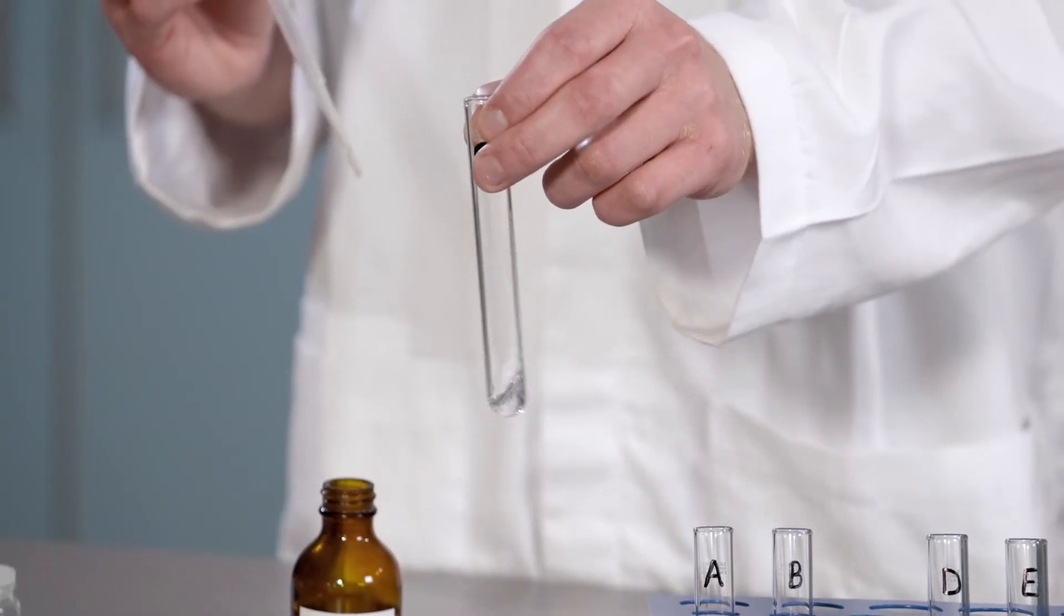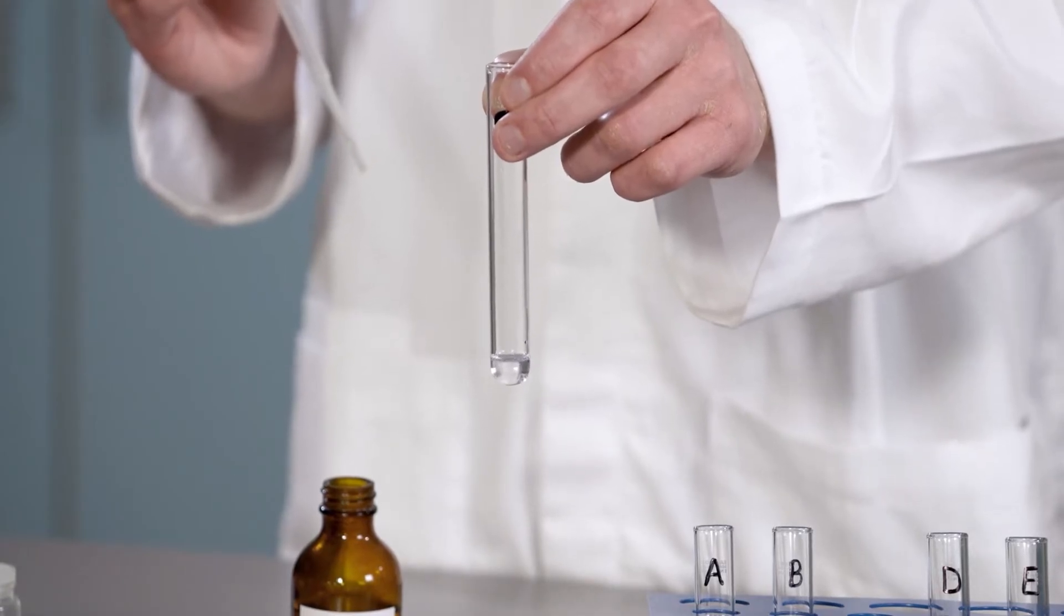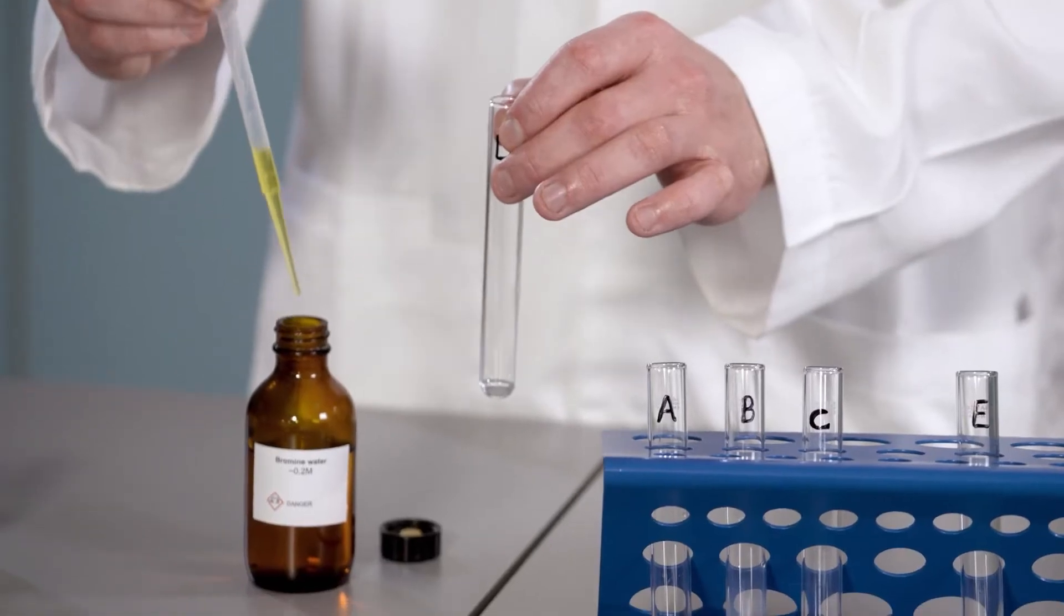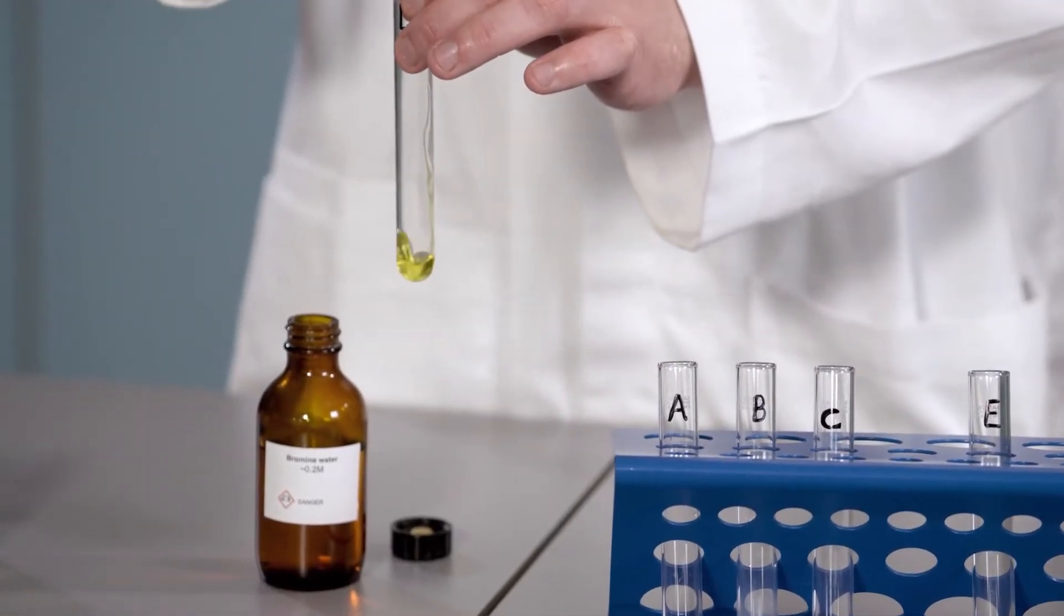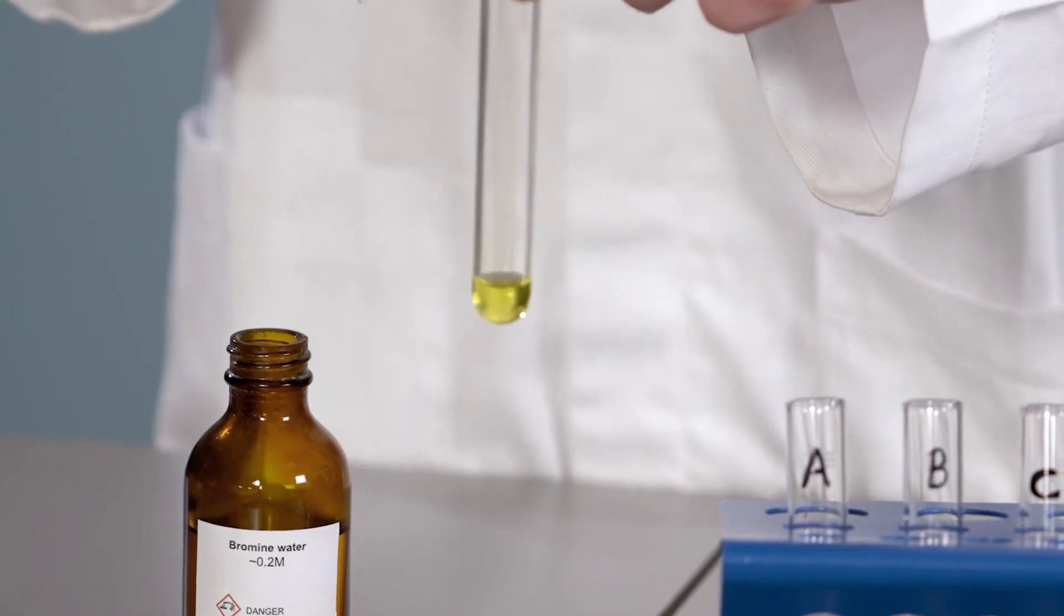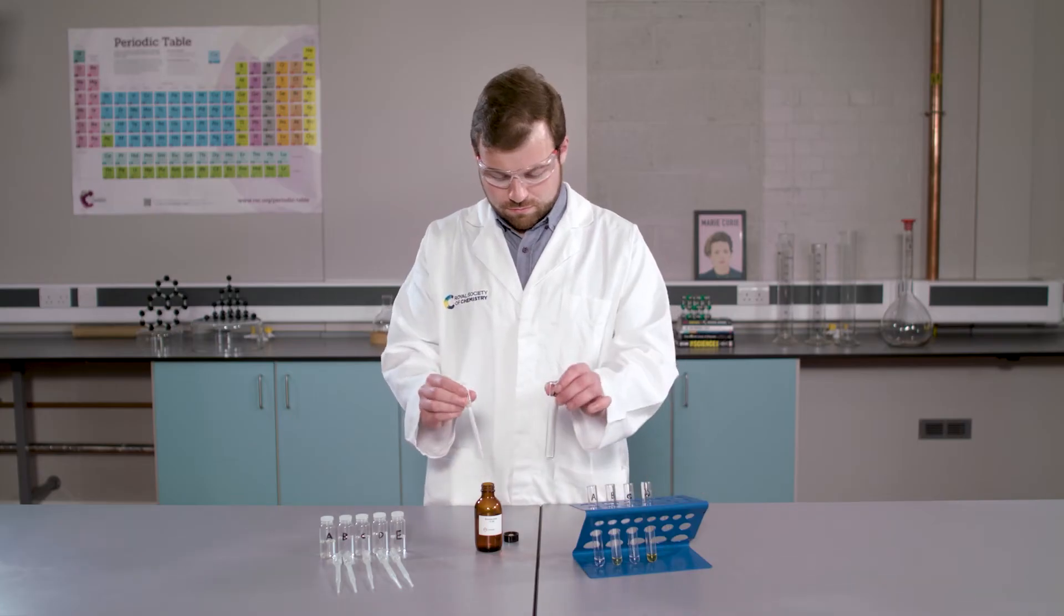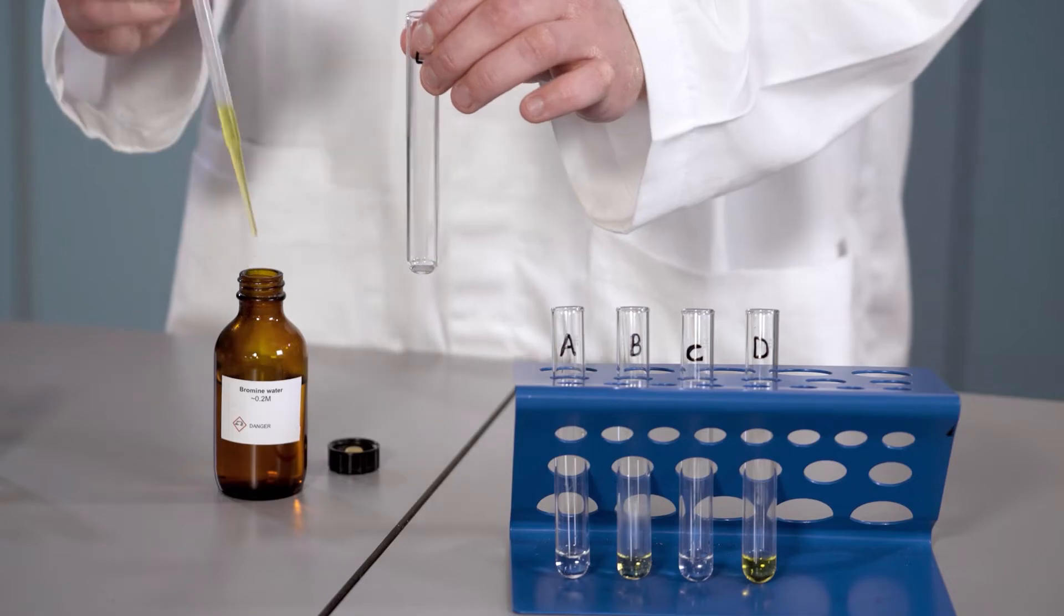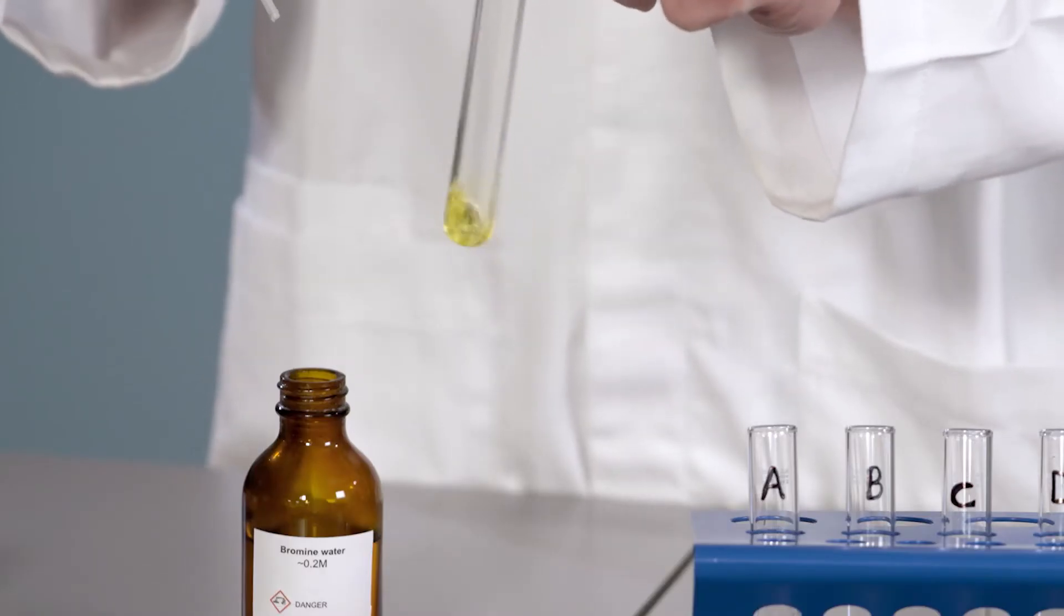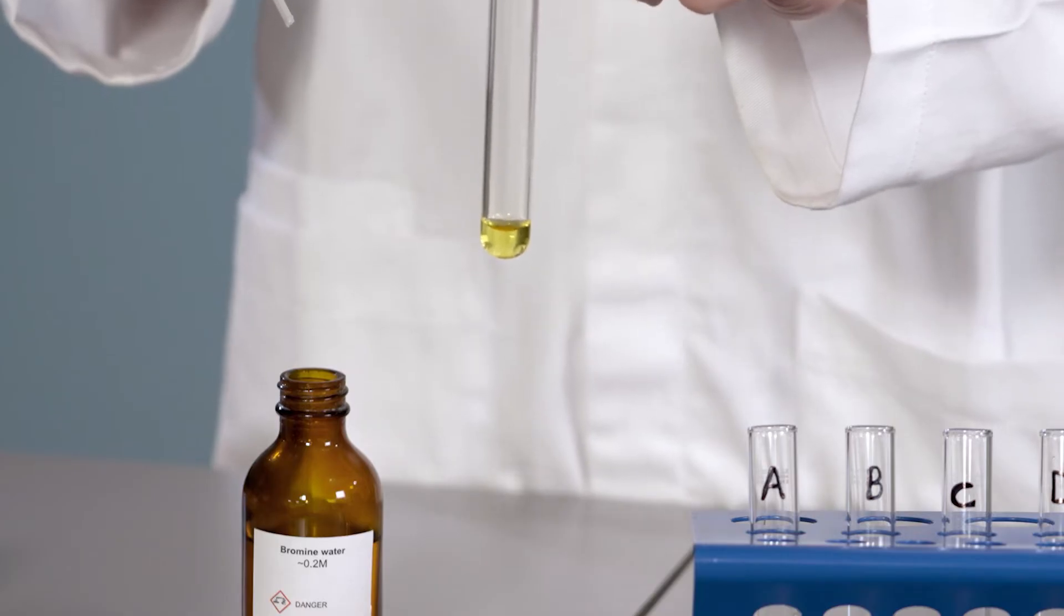Well, that was unexpected. A second positive result. A negative result for D, and another negative result for E.